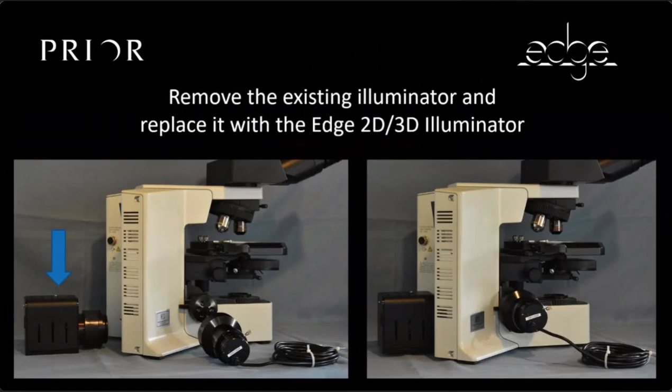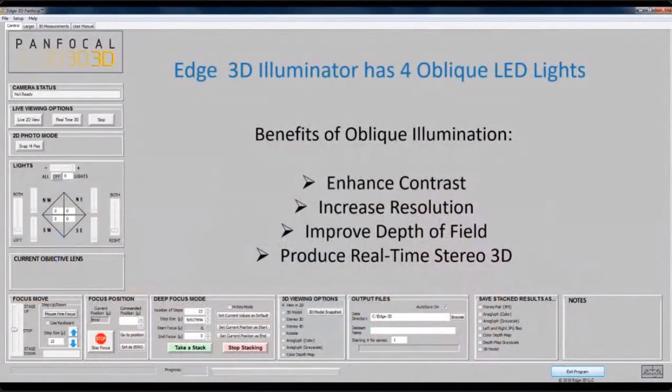So this is, again, the same old Olympus microscope. And you can see on the left, all you do is you take the illuminator and you simply attach it just like you would attach the Olympus illuminator. It attaches with one screw. So you just replace your existing illuminator which came with your microscope with the Edge 3D illuminator. And there's various plugs. You plug it into the wall and you plug it into the microscope.